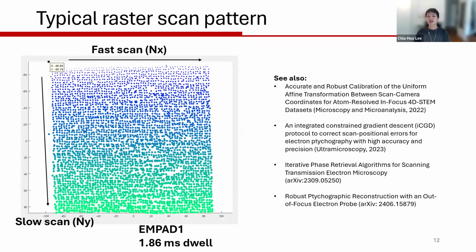Okay, so here's just an example of a typical raster scan pattern that was acquired back in my PhD on the EMPAD1, where we have a 1 millisecond dwell, but also 0.86 milliseconds of readout time. So overall, each diffraction pattern is separated by nearly 2 milliseconds, which is very slow. And given that we have a drift rate of around 0.1 angstrom per second, and we're taking only 128 by 128 diffraction patterns here, you can see that there's a significant amount of shearing happening between the slow scan and fast scan direction.